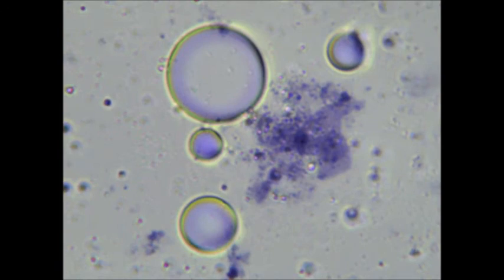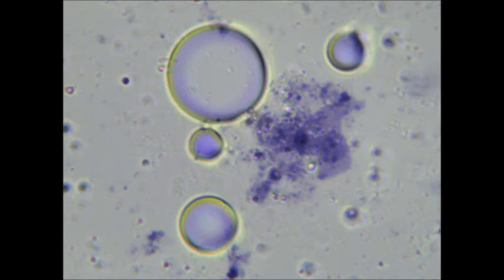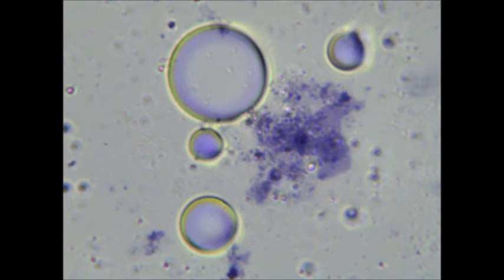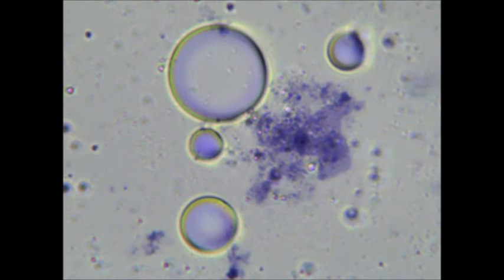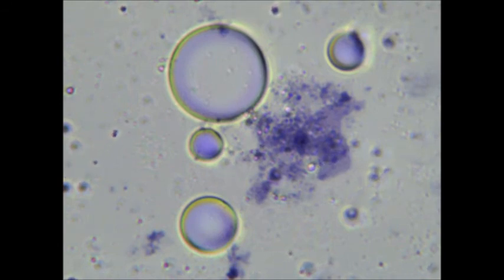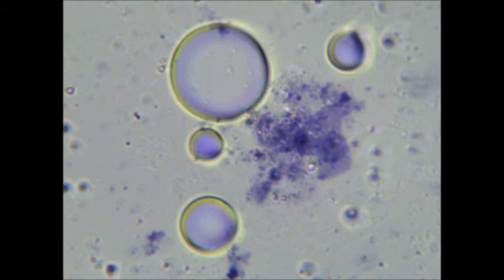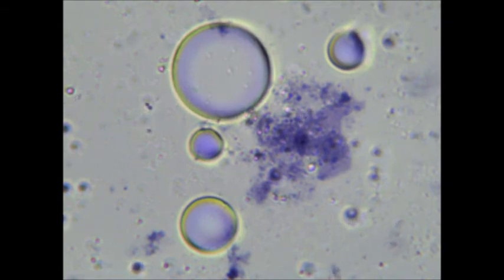But when you introduce something like rock dust, you run the risk of having it become contaminated with bacteria and other organisms if you don't properly sterilize it. So I think that I've basically come to an impasse as far as my experiments go.